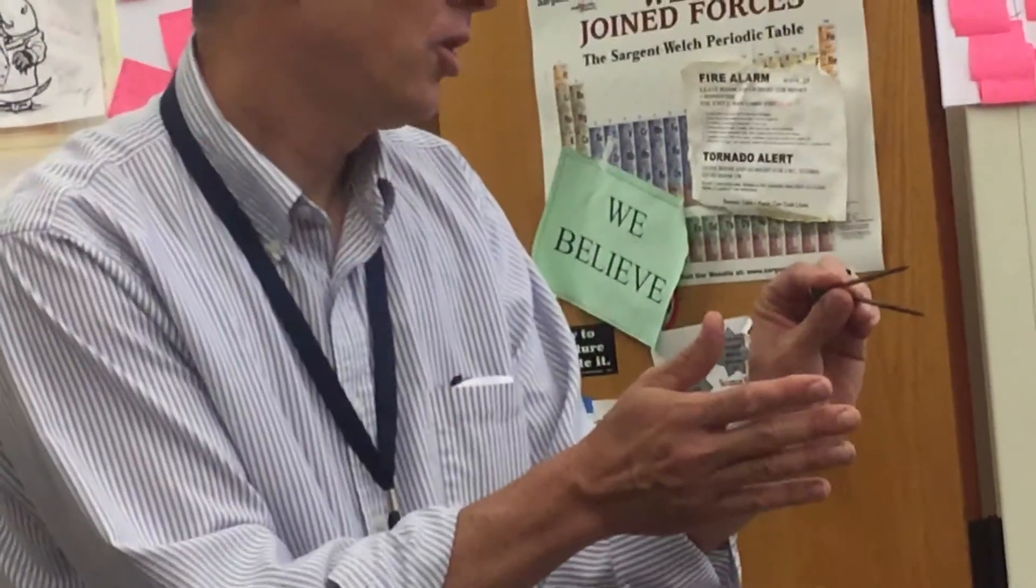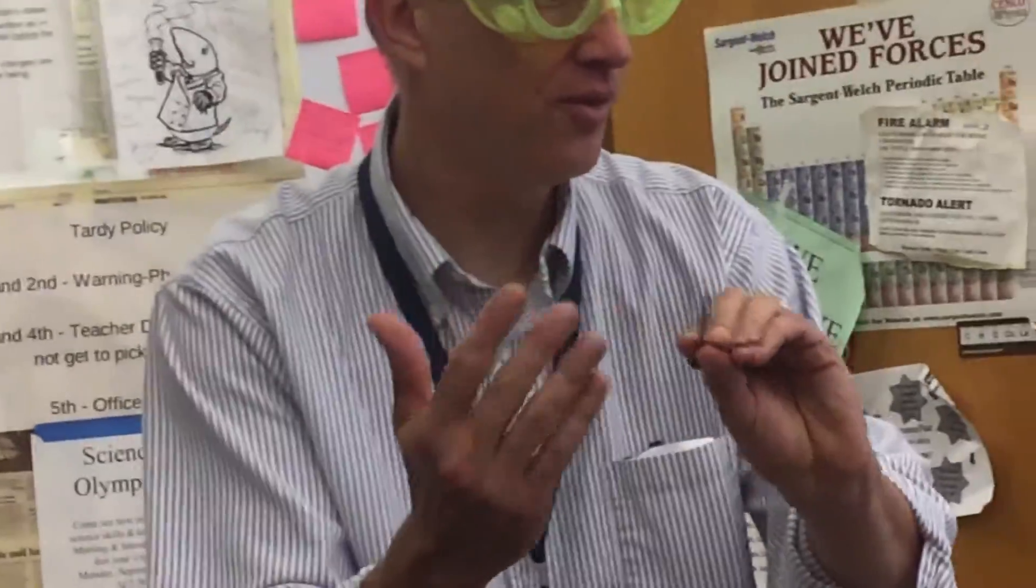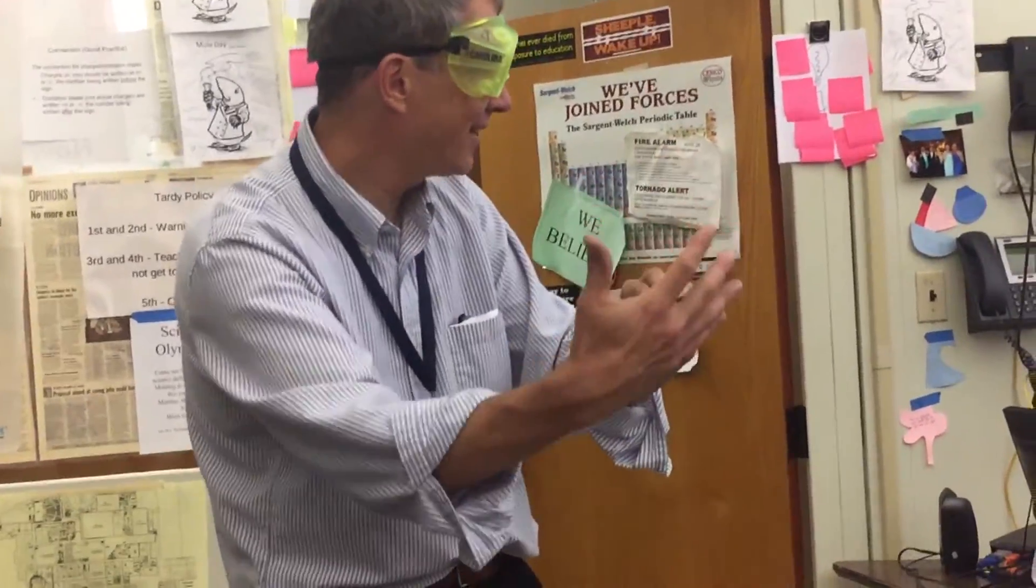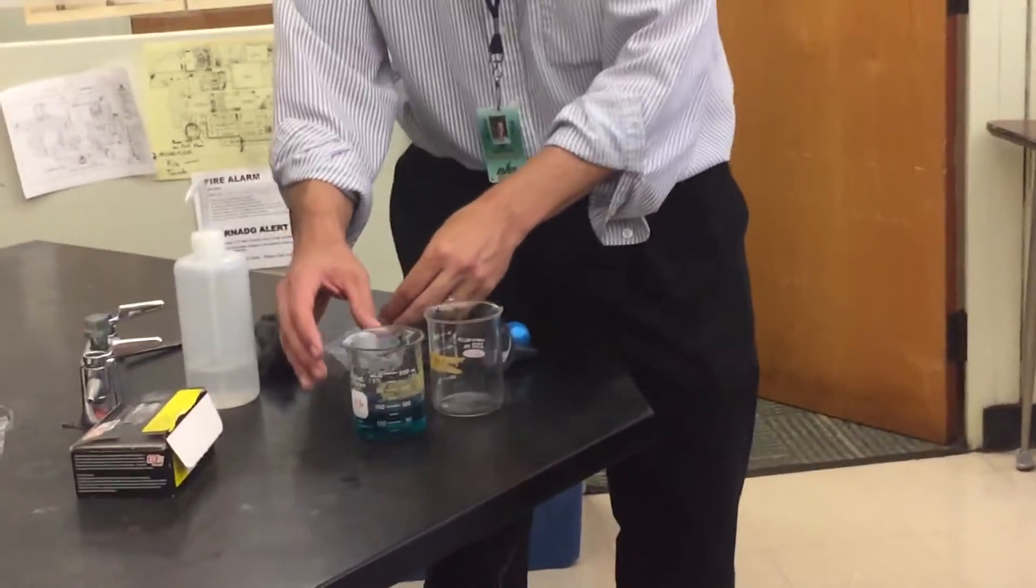I'm going to dry these and weigh them. If I do that, can I figure out how much iron we used? Yeah, do you think they'll be, if I weigh these, more or less or the same amount of iron? Less. That's because some has reacted to form iron chloride. Okay, so we keep these, we put these aside, we don't want to lose those.